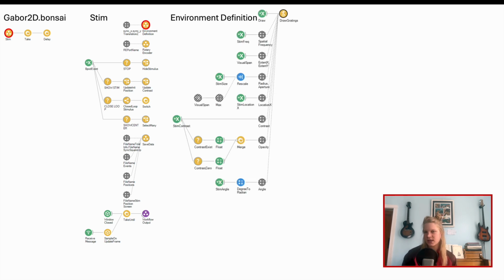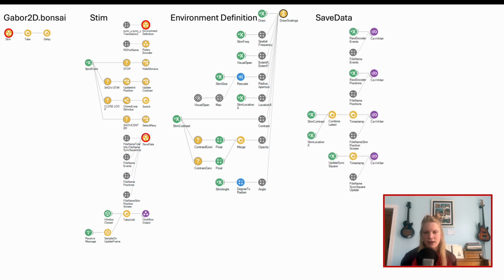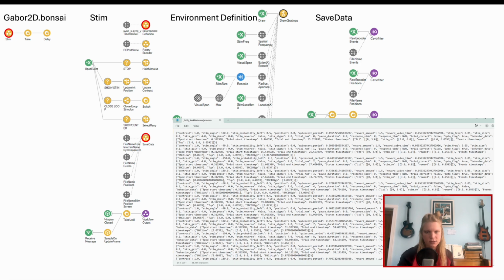Environment definition first sends the stimulus parameters set during DrawNext trial to Bonsai by the Bonsai visual stimulus mixin via a protocol described in the base tasks, and then combines these to produce drifting grating of the prescribed parameters. In save data, you can choose which settings to document and set their save path, where you can check later the output is matching the parameters you think you've set.